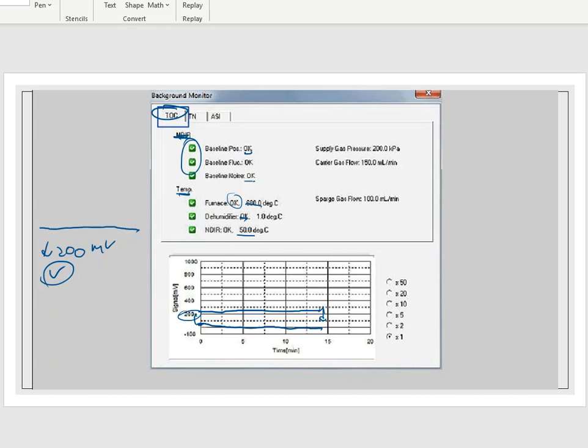Carrier gas flow is also going to be measured. Right now, this box says 150, and that's normally where ours is as well. And then the supply gas pressure. Remember, we talked about the gas tank, which is air, and that air has an intake system. And I can't pump out too much at one time. That was the purpose of the regulator.